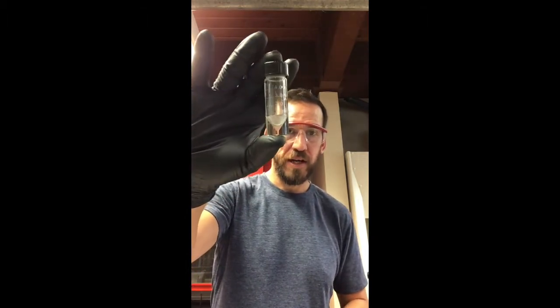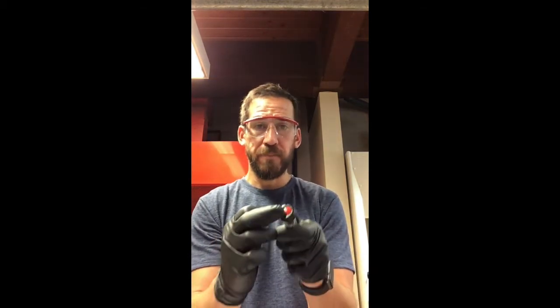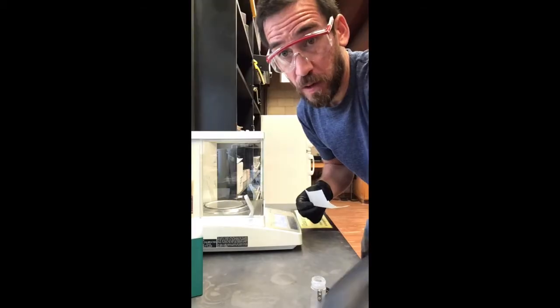We're going to place the solid inside a conical vial — remember, a conical vial has a little cone on the bottom. We need a good seal with a septum: the septum can come out and your lid has a hole in it, so make sure it fits really nicely and makes a good seal when you close the cap. Let's go get our 50 milligrams of benzoic acid first.